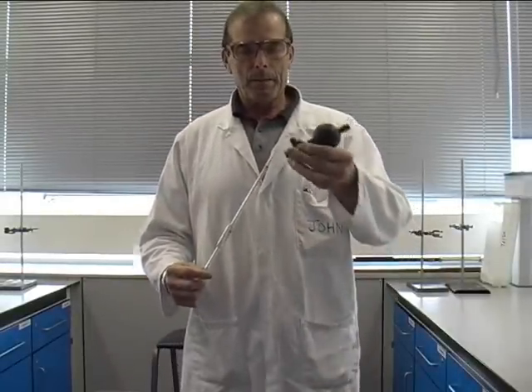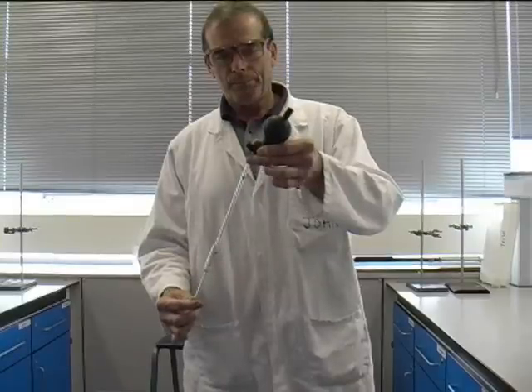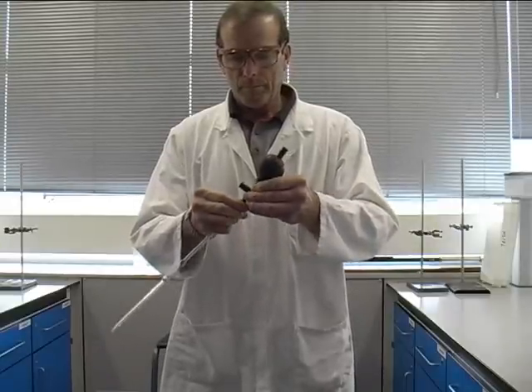A safety bulb must be used for all pipette work. It is important to fit the bulb correctly to the pipette. Holding the pipette too low down could result in injuring your hand. Hold the pipette at the end and gently ease it into the bulb.